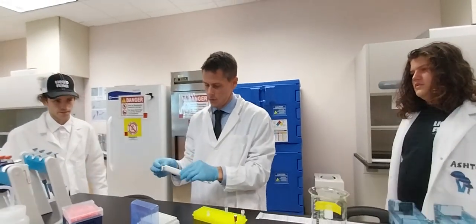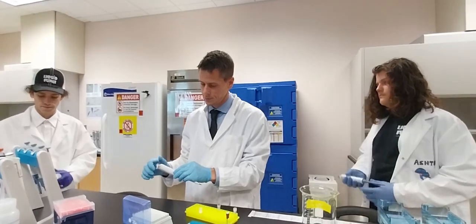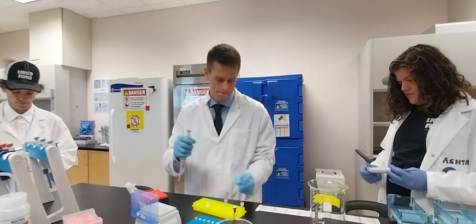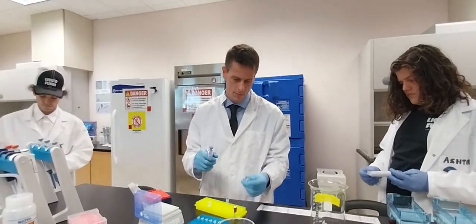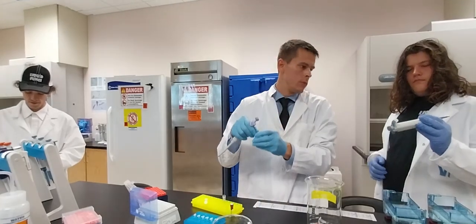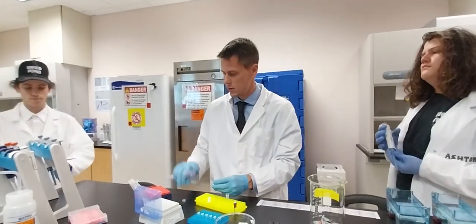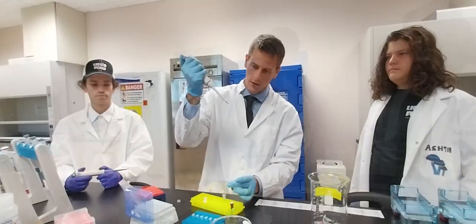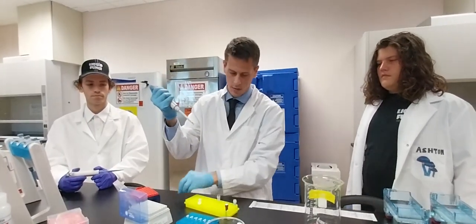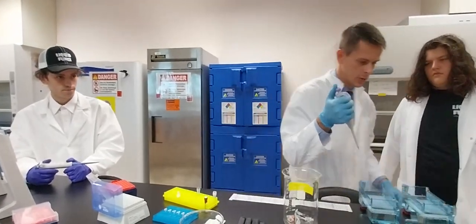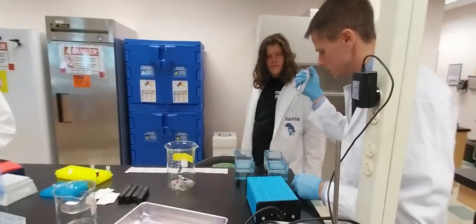So, 5 microliters. We'll go 5.0. So you see that at five. So what we're going to do is we're going to come over here. This one doesn't need mixing, it's already mixed with its own loading dye.